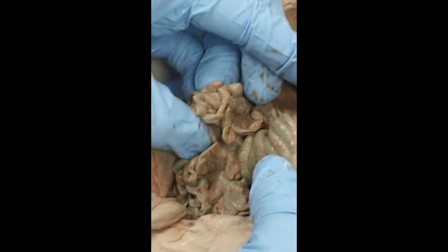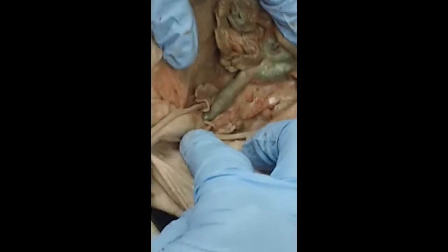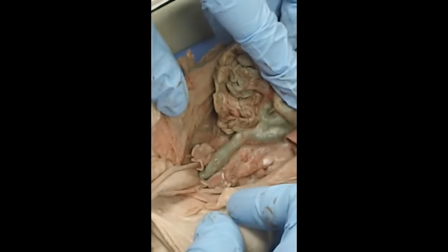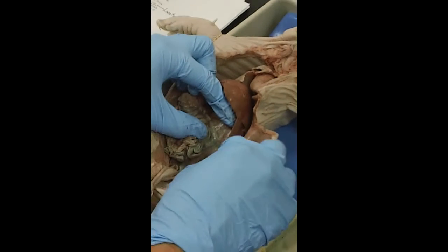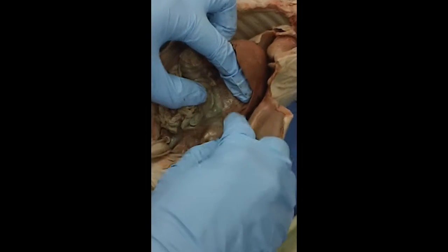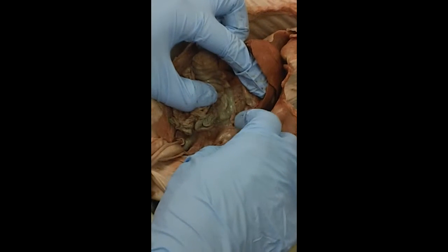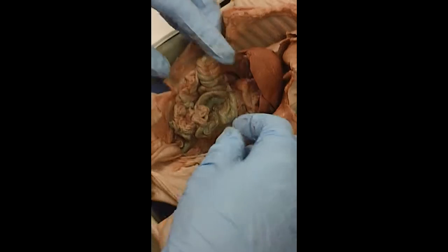If you follow the small intestine along, you get to the large intestine, also known as the colon, and that absorbs excess water and solidifies waste. And if you follow that out, that is the rectum, and that is what stores the fecal matter or the solid waste until you eliminate it from your body. Some other accessory organs of digestion, right there is the pancreas. And the pancreas makes pancreatic juices that are also put into the small intestine for digestion.